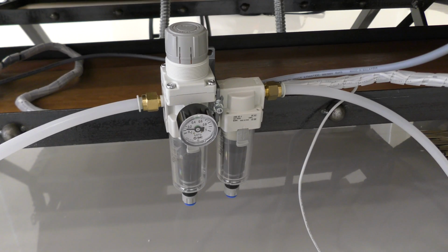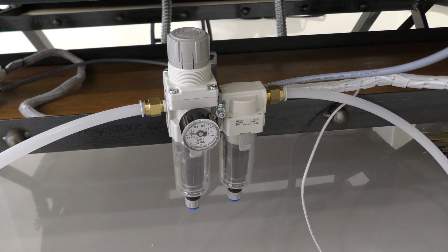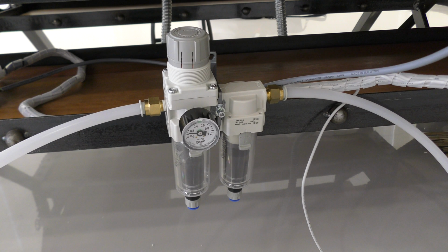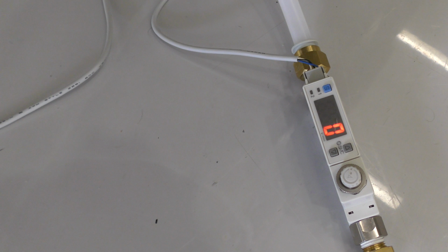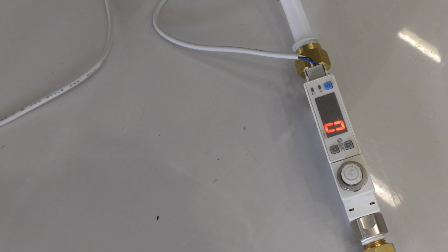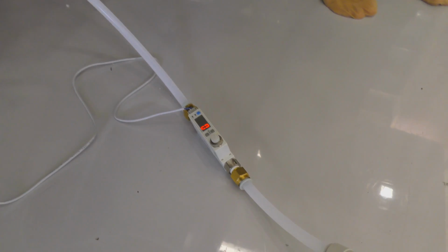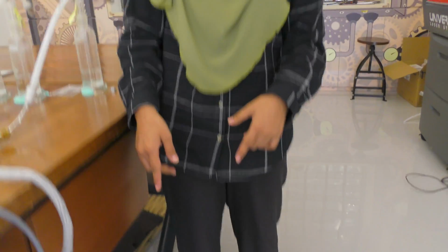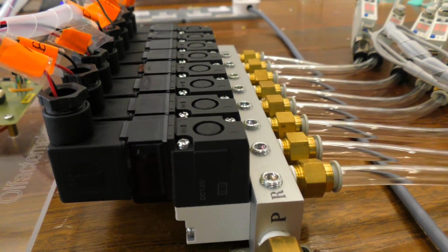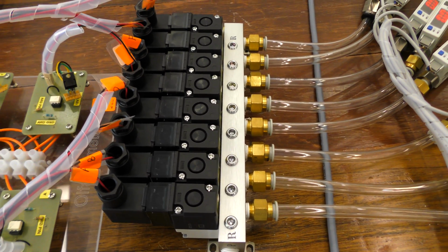Then we will need the regulator filter combined with the mist separator. This functions to make sure that the airflow in the system is clean and dry. The third one is the two-color digital display flow switch. This is to ensure that the flow rate of the air is measured accurately. In this system, we must make sure that the flow rate is below 10 liters per minute. After that, the air will flow to the solenoid and manifold.